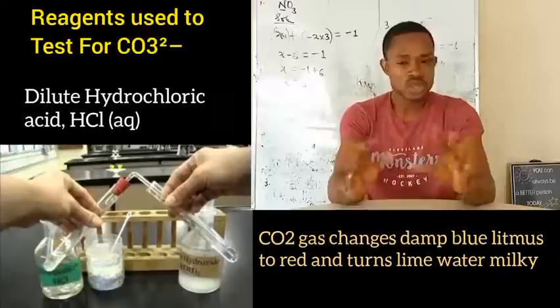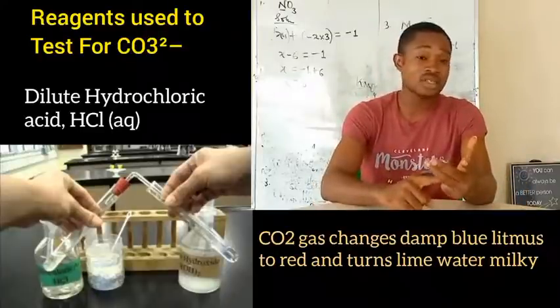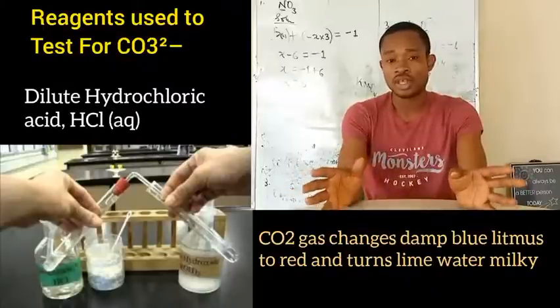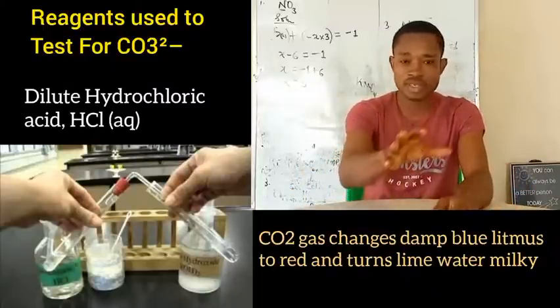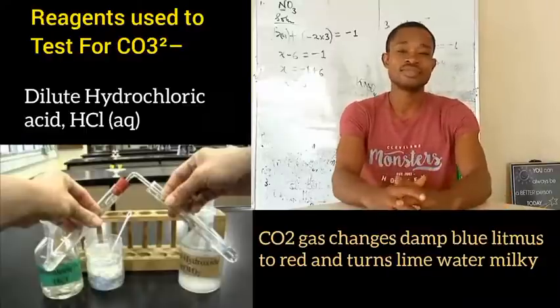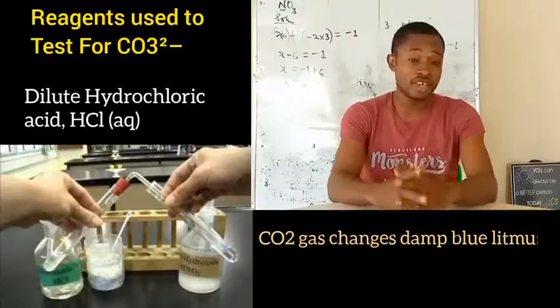In summary, we use dilute hydrochloric acid to test for trioxocarbonate(IV) anion, and during the process, carbon(IV) oxide is liberated. Let us move on to the next negative anions — trioxosulfate(IV) anion and tetraoxosulfate(VI) anion.